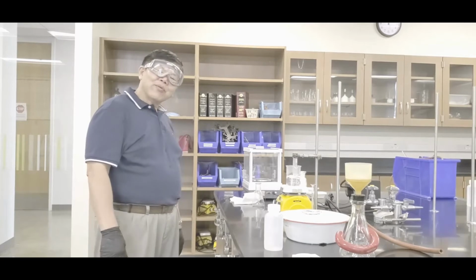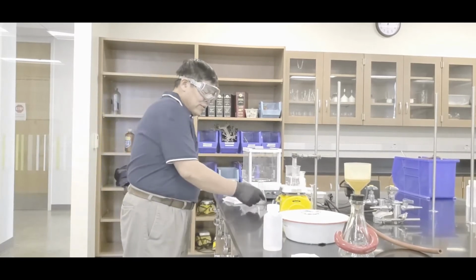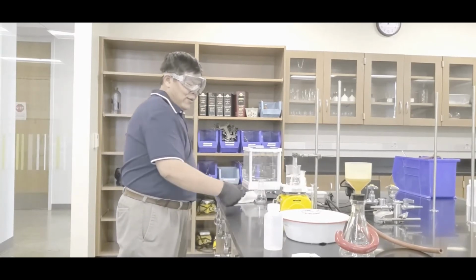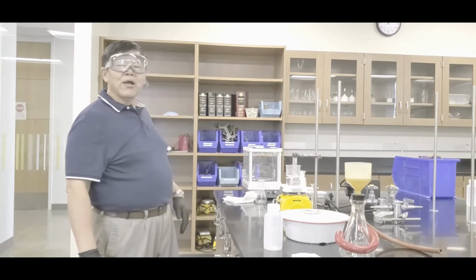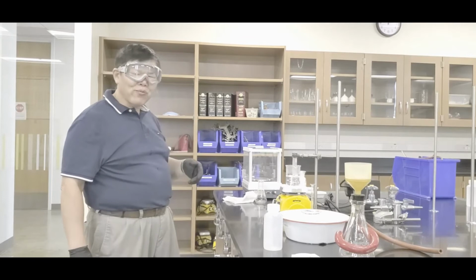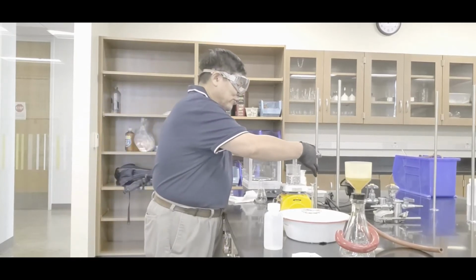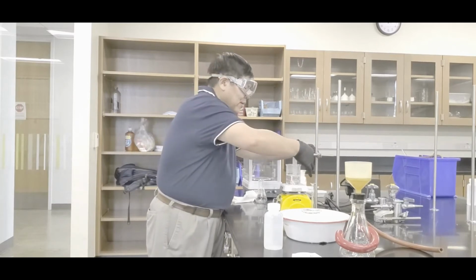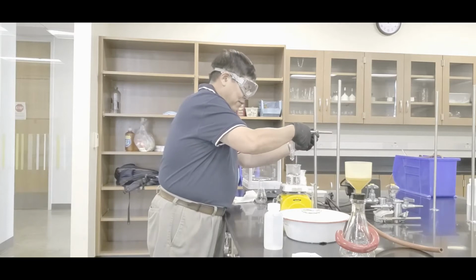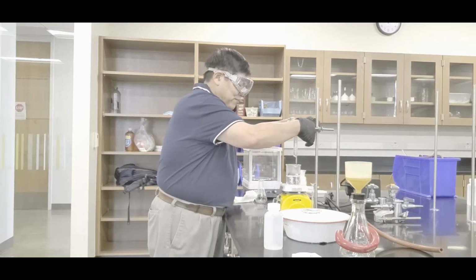All right, class, we just finished cooking. So what you want to do is this: make sure you shut the guy off. Okay, the green light goes off. Now the next thing is this. Before you stop the reaction by adding water, you want to lift it up and let it wait about a minute or so. Otherwise, it can go a little violent. So this is what you do. Okay, like this. Pick it up, and then lift it up above. Okay? Wait about a minute or so.